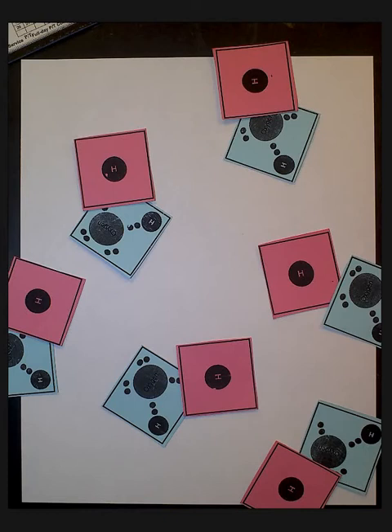Nerdettes, let's go. Okay, so I'm going to talk you through the 5 different sections in case you're having a little bit of trouble.